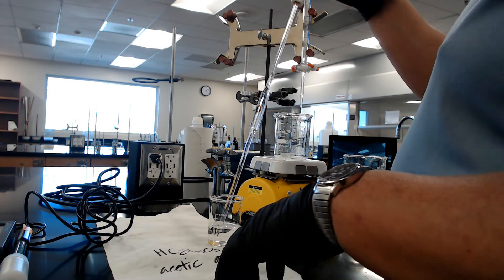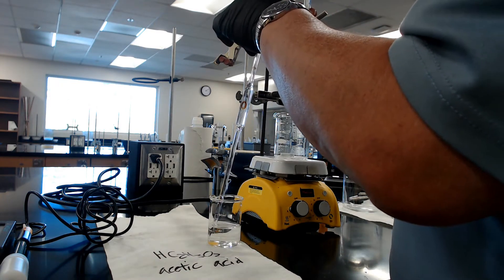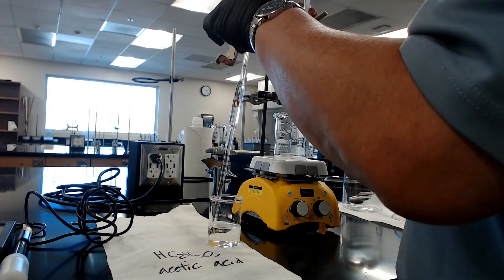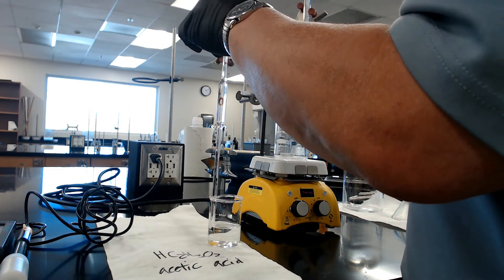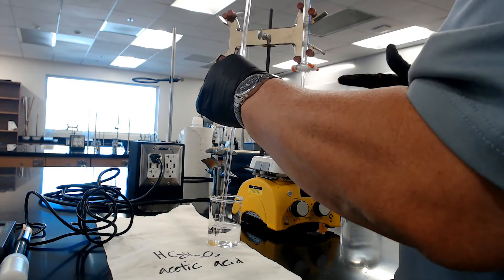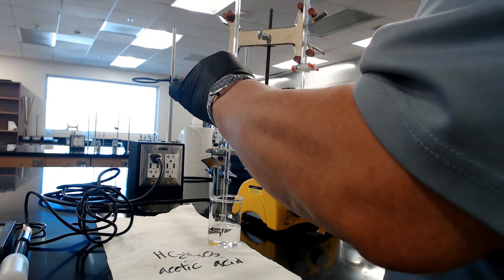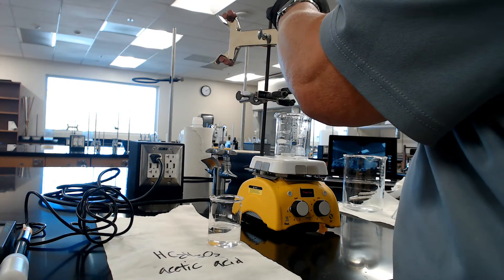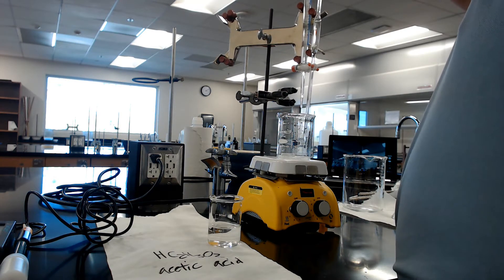Alright class, we've done part A. After I finished reading the initial and final, I had about 12.4 milliliters. This time around, I'm going to add half of that. Between part A and part B, you got to pour it out, clean it out, you got to dry out the beaker too. That's concentration sensitive. I drew up about 10 milliliters of acetic acid. I'm going to dispense again.